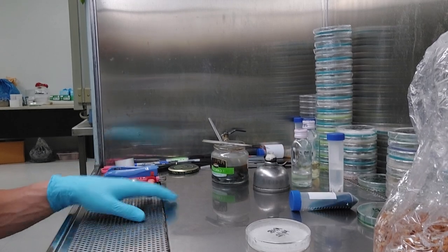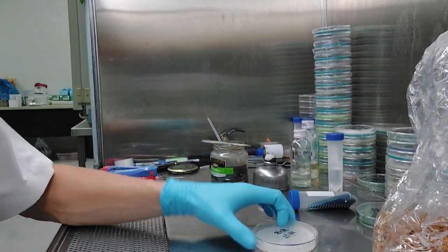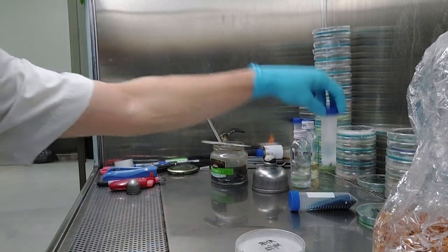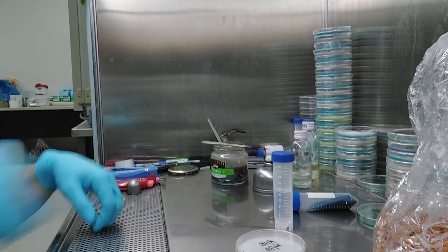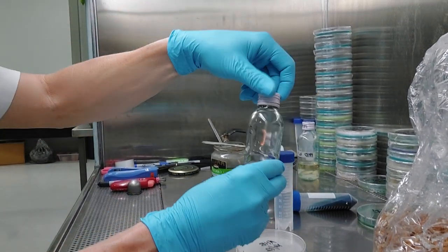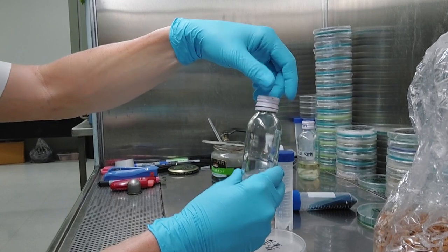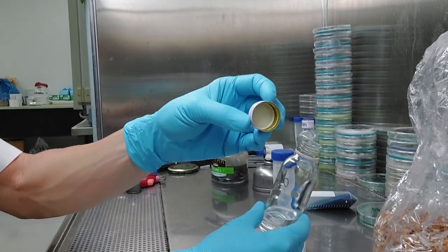The main point of this is I'm gonna make a bag up to spawn. I'm going to put my culture into long-term storage using sterile water, sterile tap water, and this fancy stand-up tube. I'm also going to put it into sterile water, which I've autoclaved in this nice glass bottle with a metal cap. See, it's got a little insert in there.